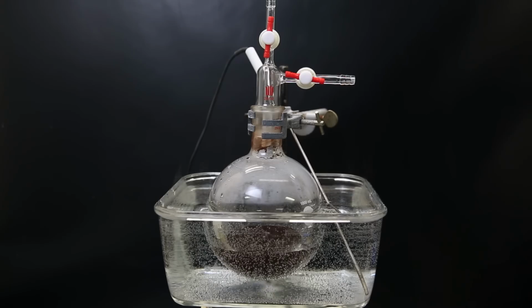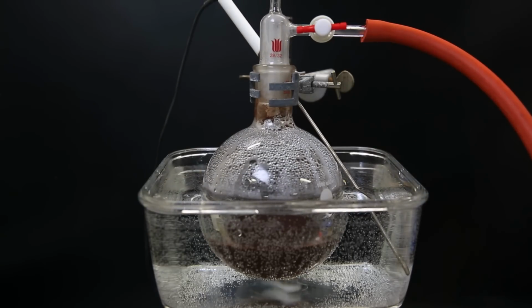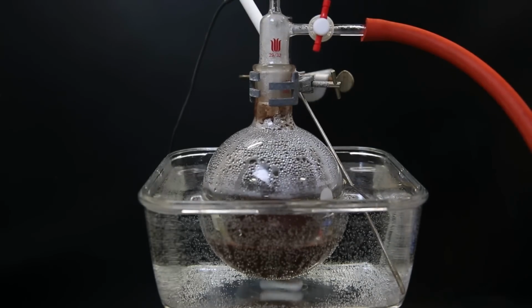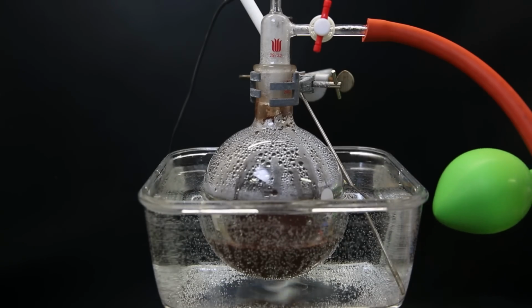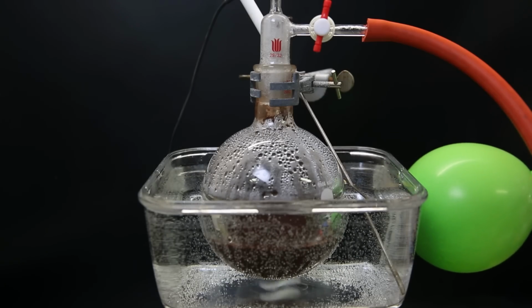I then add a two-way gas adapter connected to a vacuum pump and a balloon filled with acetylene. I pull a vacuum to remove most of the air, then close it off and open the way to the acetylene balloon, causing the flask to be filled with an atmosphere of acetylene. I do that a few times to make sure most of the air is removed. I then keep the way to the acetylene balloon open to allow for constant consumption. When the balloon becomes empty, I replace it with a new one, and I occasionally redo the pumping process if the consumption seems to be very slow.